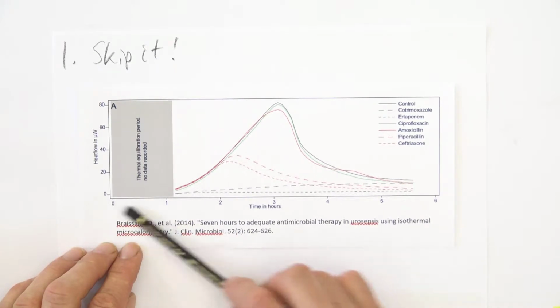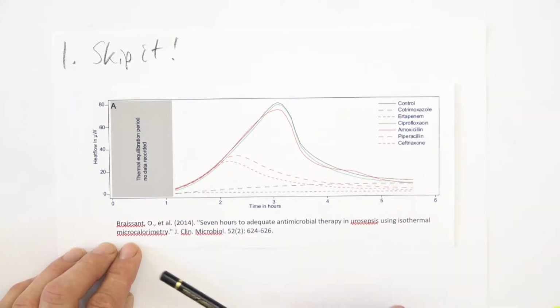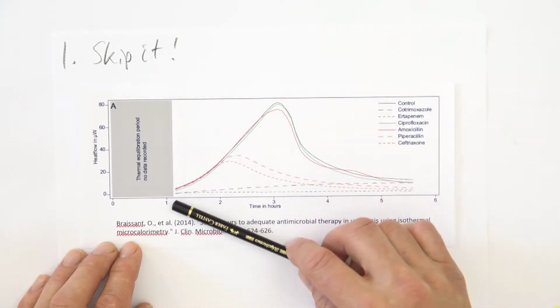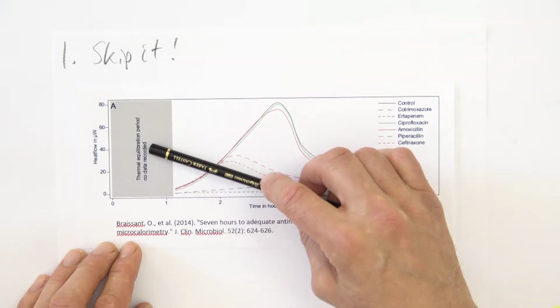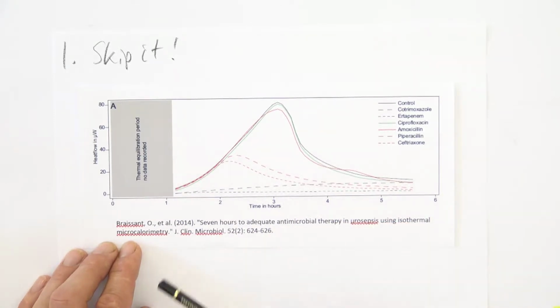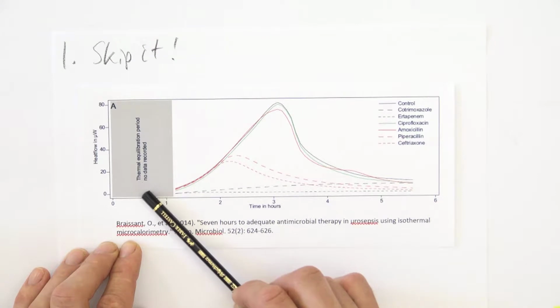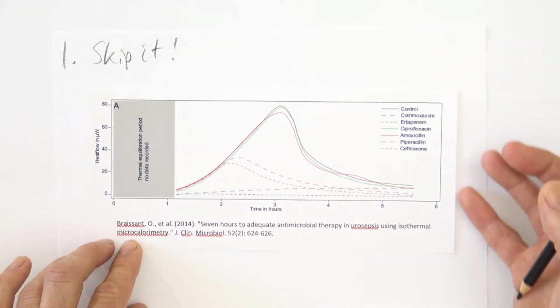Because here, this is a medical experiment, medical measurements, 5.5 hour data. And here we have a gray box for a little bit more than 1 hour saying thermal equilibration period, no data recorded. So here, these authors make it really very clear that the signal that we have here, which maybe goes from below and then goes like that, should not be evaluated, should even not be looked at. That's good. So that was the first, skip it.